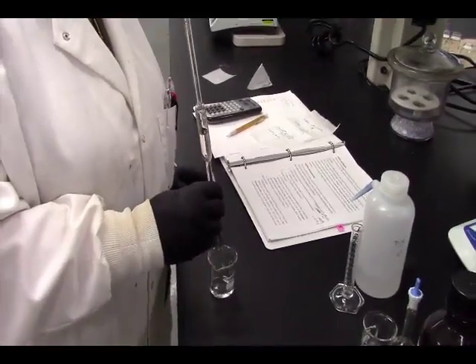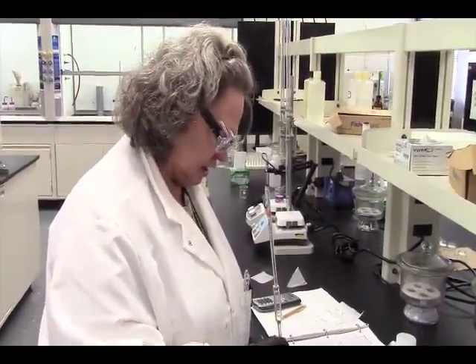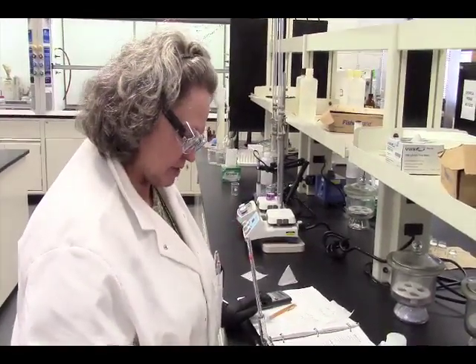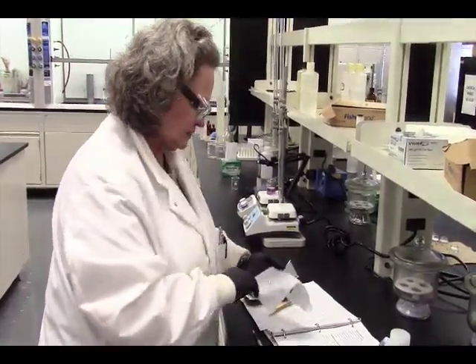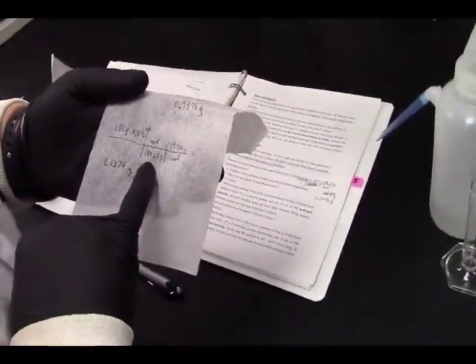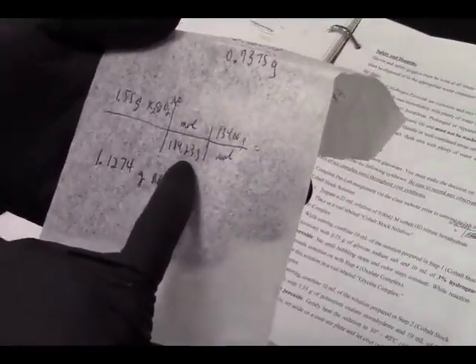Okay, so this is where we as chemists improvise, because when we looked up our stock, we do not have potassium oxalate to do the ligand exchange, but we do have sodium oxalate to do the ligand exchange. Now, if I need 1.55 grams of potassium oxalate, and that is a monohydrate, the molar mass of potassium oxalate monohydrate is 184.23 grams per mole.